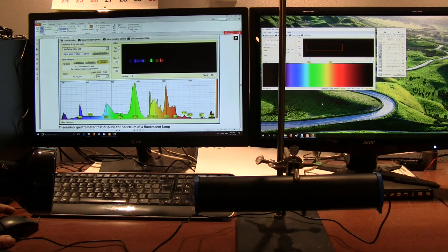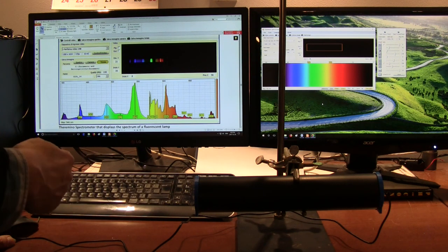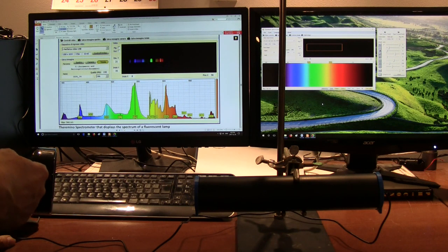So what I wanted to show first was the calibration of the visible light spectrometer. So I've got the spectrometer right here. We've got it set up with a lamp on this side that's a CFL type lamp, which is going to give us our sample spectrum.